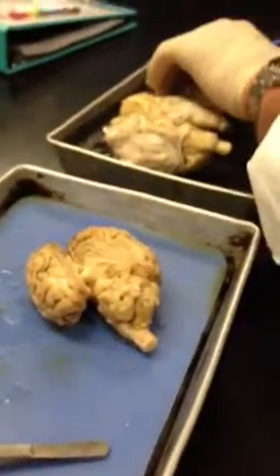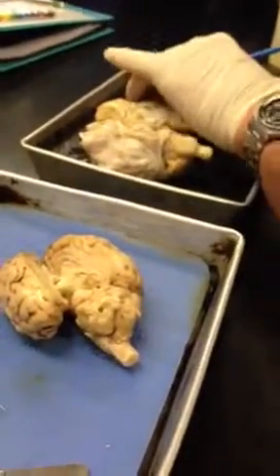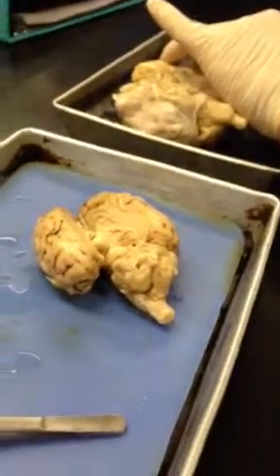Now let's look at these sagittal section brains. That's where you get a lot more of the kind of stuff you need to see. All right, so the cerebellum, and there's the tree of life. You can see it there, right? All those little branches and things. I mean, I think it's a pretty cool name, right?